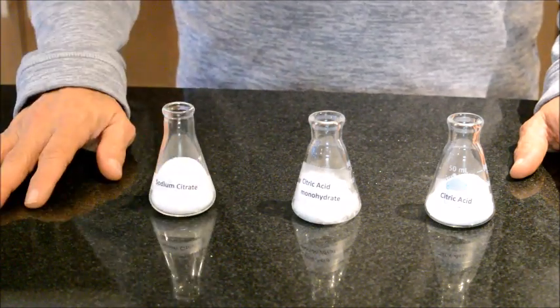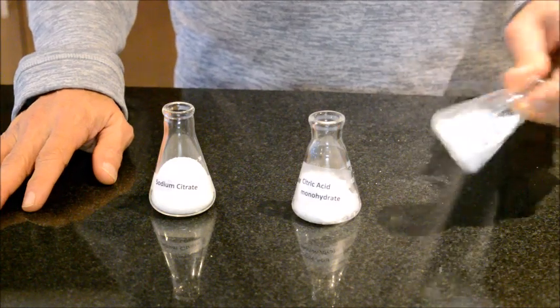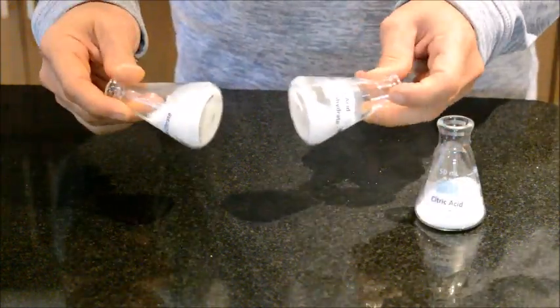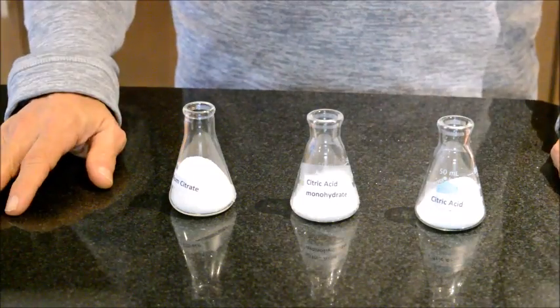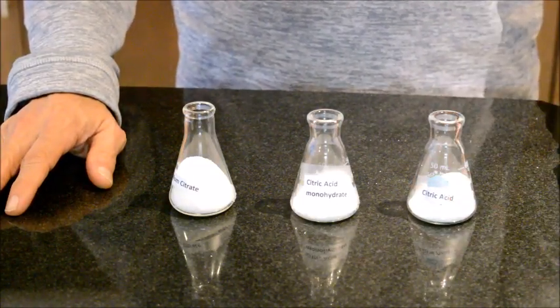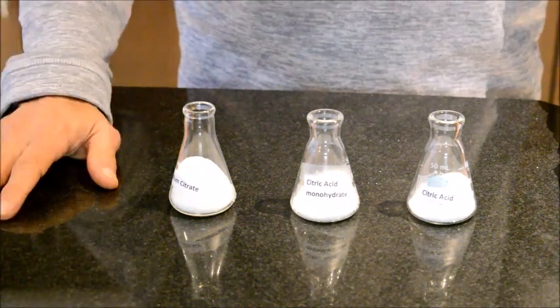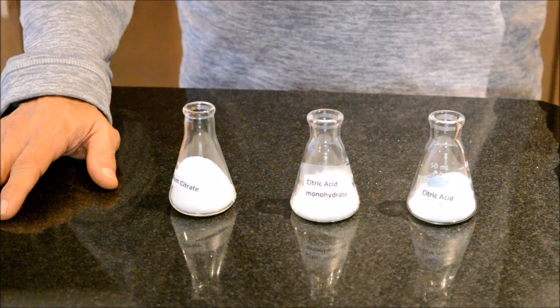By looking at these three excipients we cannot see much of a difference. All three of them are white color and also if one wants to smell them they don't have any smell either. There's no smell whatsoever.